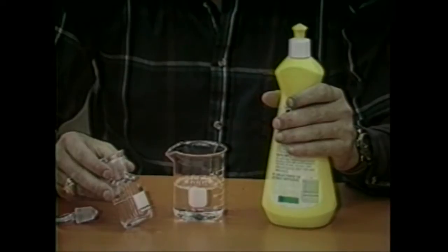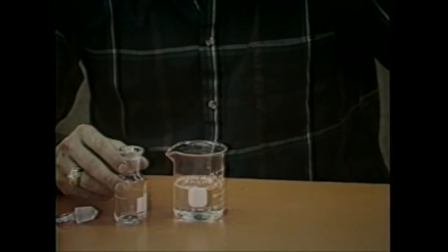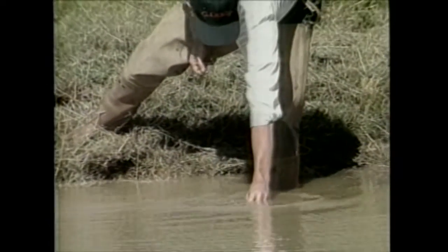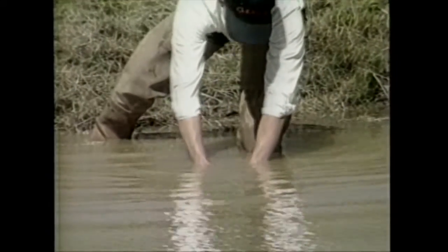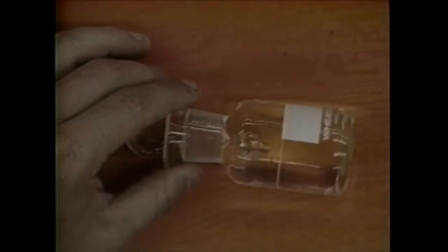To measure dissolved oxygen using the water quality test kit, obtain a water sample from the pond by using the glass stopper dissolved oxygen bottle provided with the kit. The bottle should be cleaned before and after each use using dishwashing detergent, making sure it is rinsed well with clean water, preferably distilled or tap water. The sample should be taken away from the pond bank to avoid vegetation, away from aerators and flowing water, and preferably with the wind at your back. This will usually give you the lowest reading in the pond. To take the sample, submerge the bottle approximately one foot below the surface. Un-stopper to collect the sample and then re-stopper the bottle under the water to ensure that no air bubbles are trapped. Air bubbles will increase the dissolved oxygen value by dispersing oxygen from the trapped bubbles into the water sample.